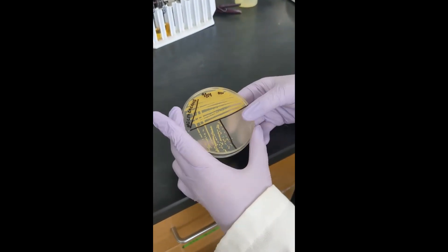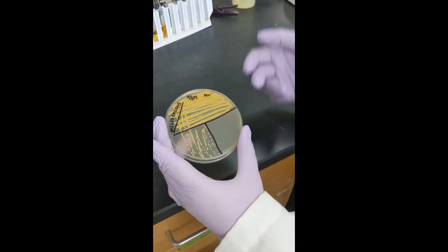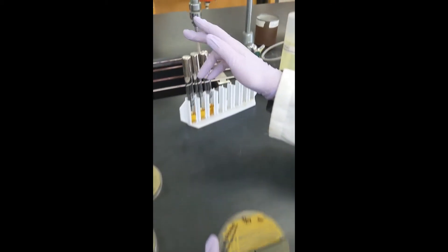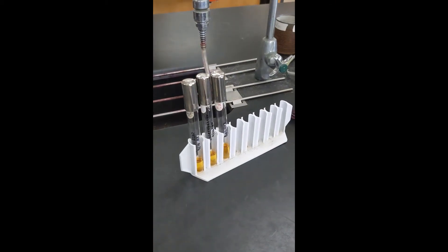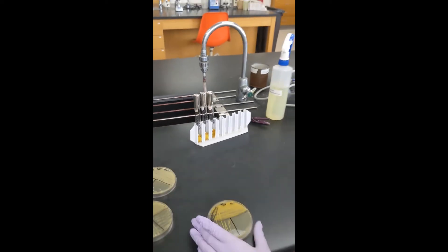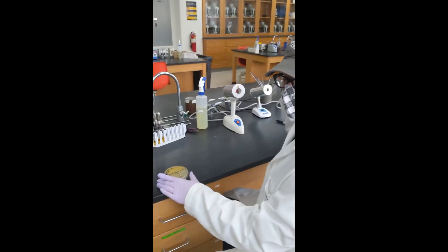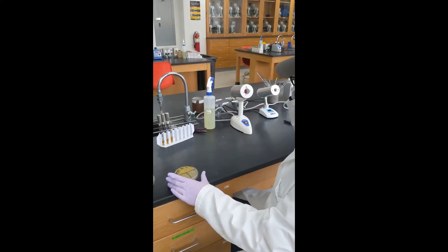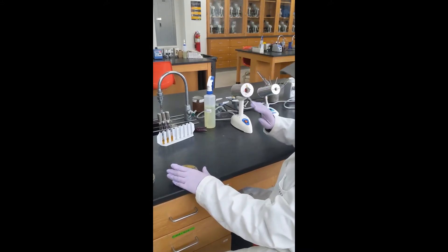We will be picking isolated colonies from these plates and inoculating them into our broths. I have already labeled each of the broth tubes with the appropriate species that we will be inoculating them with. But first things first.